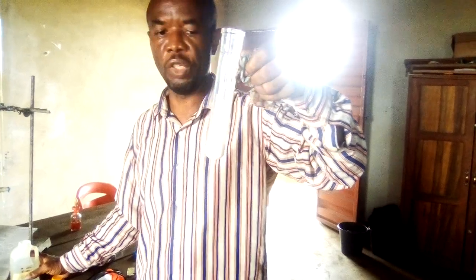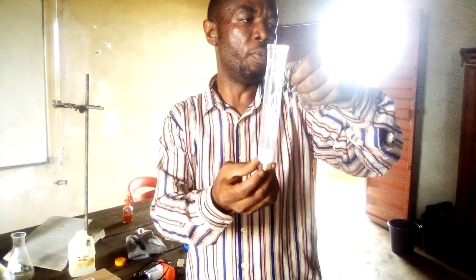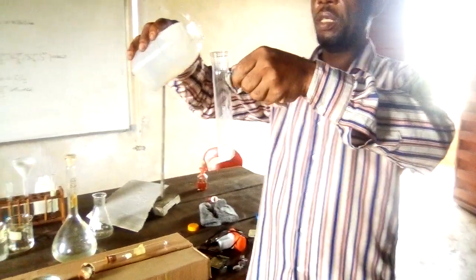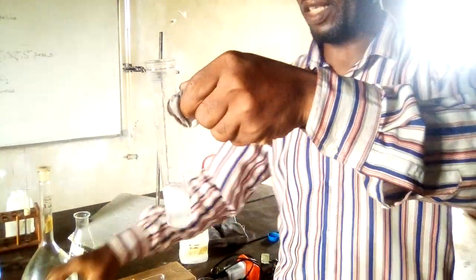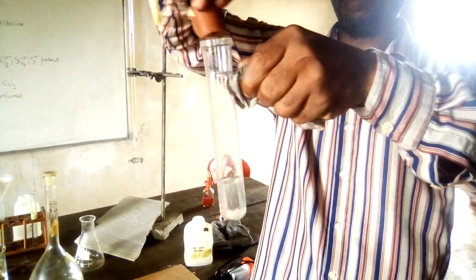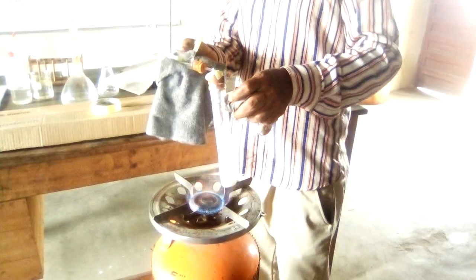So this is the mixture from question 2C containing C aqueous and barium chloride, the white precipitate formed. We're going to add HCl into it. As observed, it's bubbling, a gas is coming out. We need to cover this and test for the gas. So we are heating this.